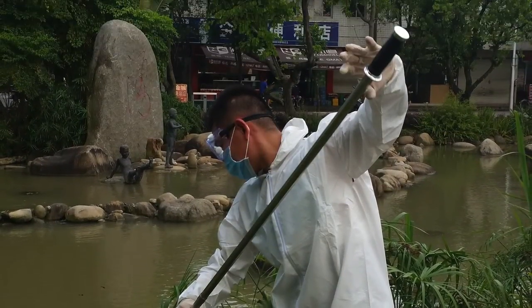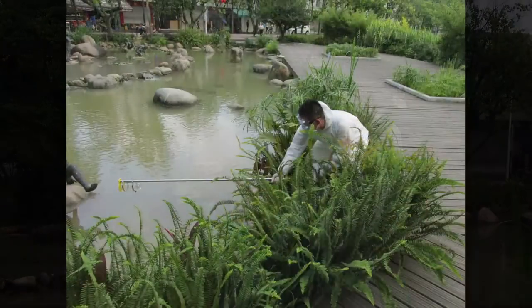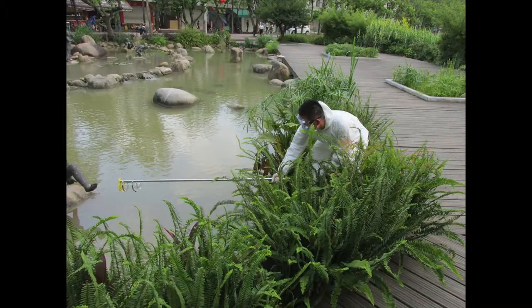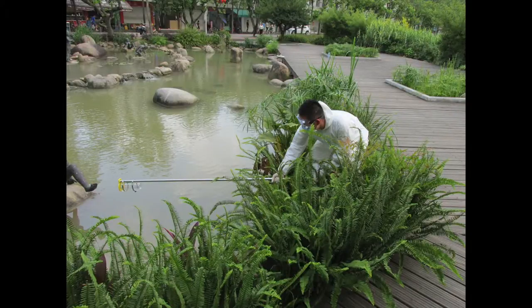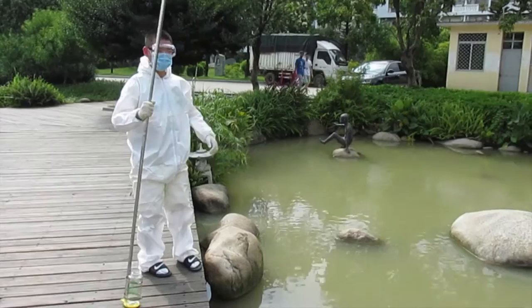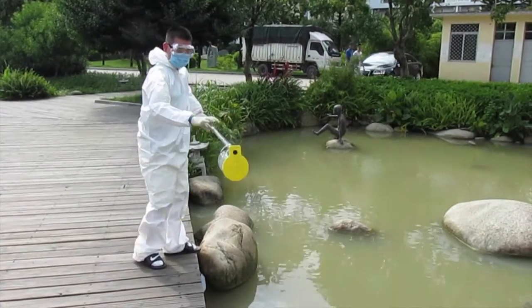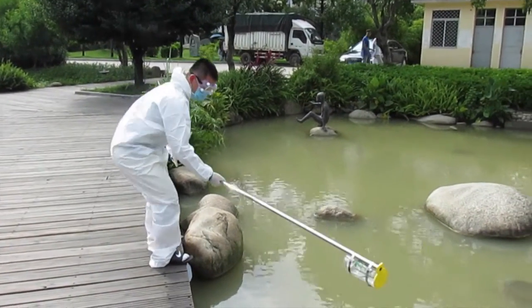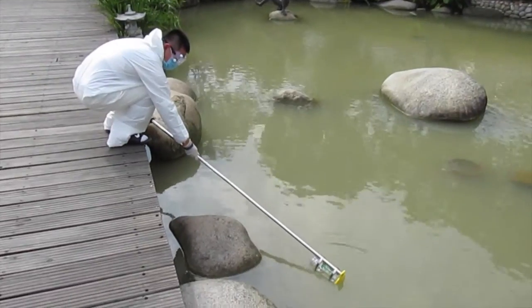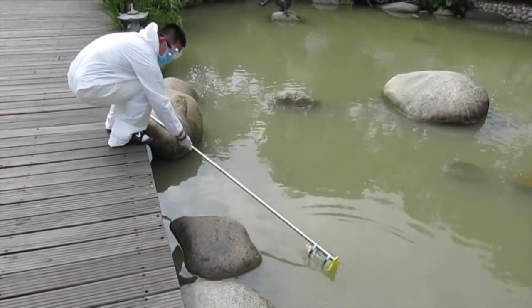Before going out to the water sampling site, we need to use a random number generator to determine which sites we need to sample the water. After targeting the site, we will use glass containers and dippers to collect the samples needed, beginning with the furthest one downstream of the flow.